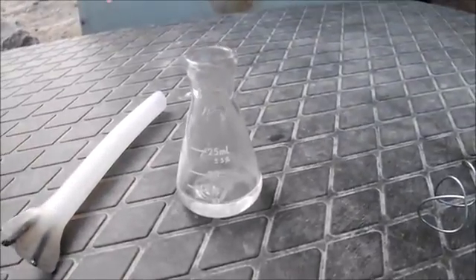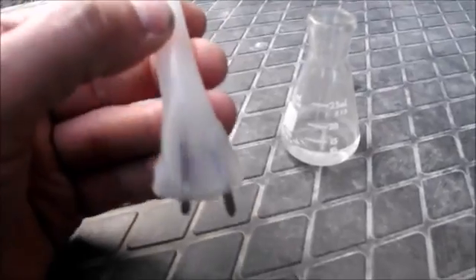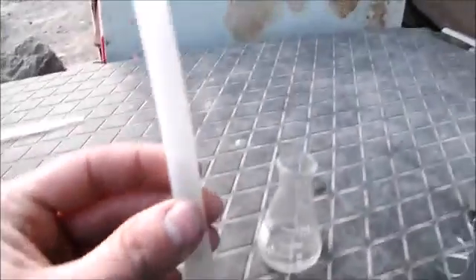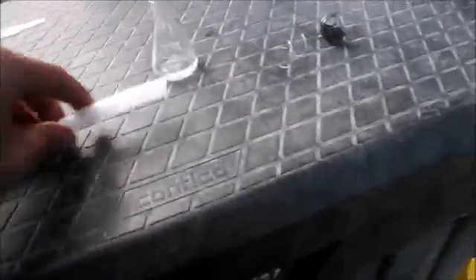Just three or four drops is all I'm going to put in. Let's wash that down. I have made this little electrolytic cell. I've got these lead sticks stuck in the bottom of this plastic tube. I'm going to transfer the fluid into this and then use a very small battery charger to electrolyze it — very slowly.